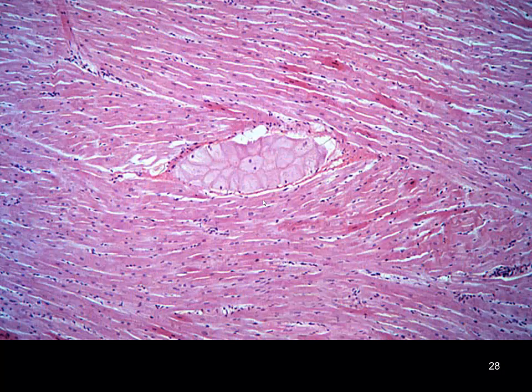Now we're shifting gears even more. As we look at this image, the first thing that you should be impressed with, not with just this material right in the middle, just ignore this for now, but you see tons and tons of nuclei. Now, you see the reddish pattern to this, the wavy pattern that you might see up in this portion of the image.